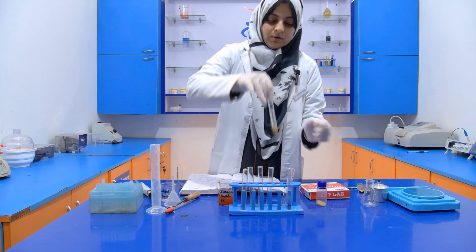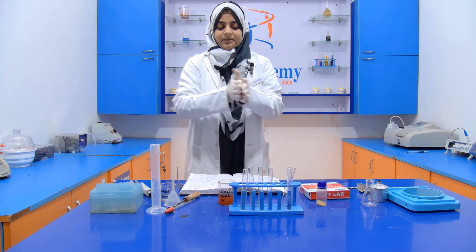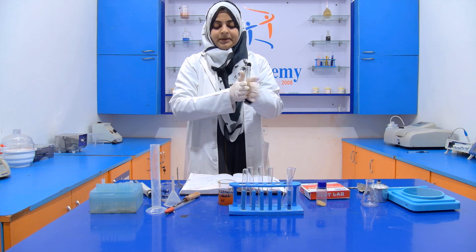Now dissolve it completely by shaking it.